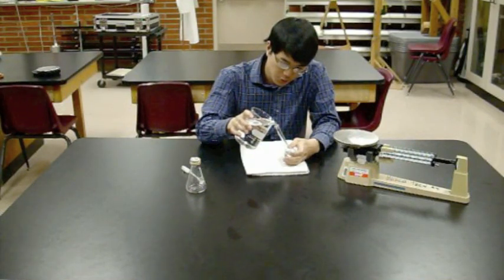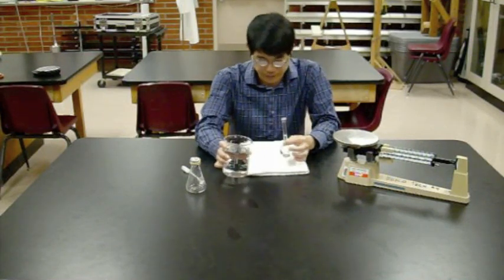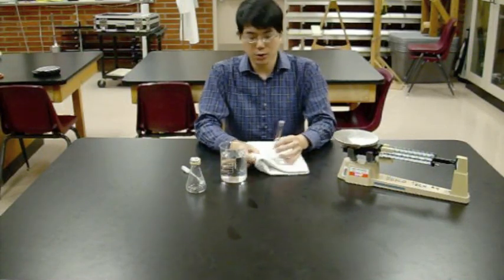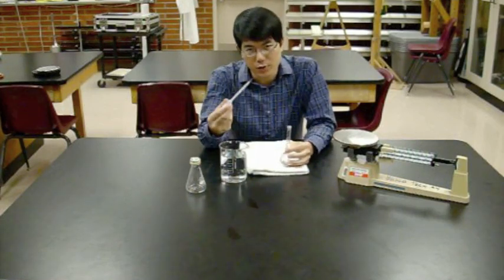Don't worry, this is just tap water. So if you spill some, it's absolutely, or about as harmless as chemicals can get. And chances are, you'll either overshoot or undershoot a little bit. So that's where this device comes in handy.